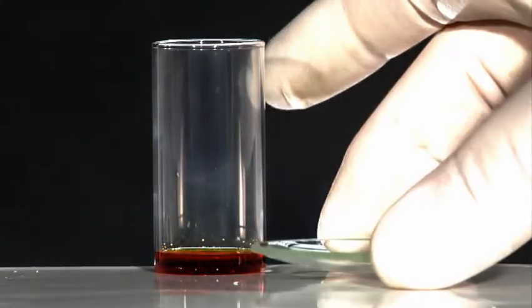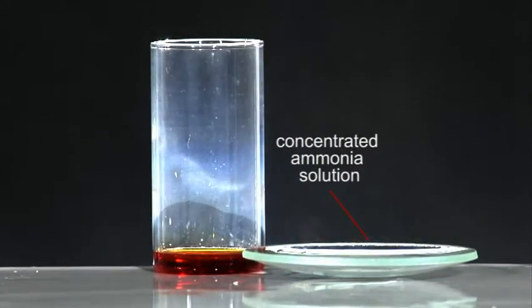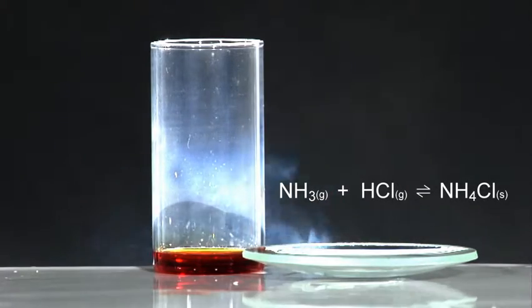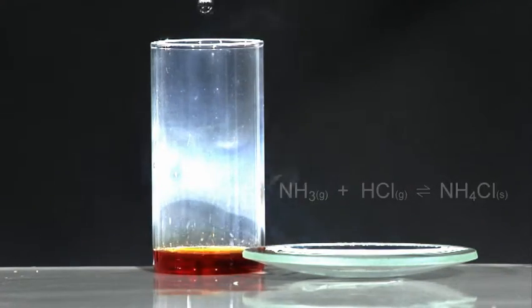Including hydrogen chloride. Here, a concentrated solution of ammonia is used to show the presence of hydrogen chloride gas produced by the hydrolysis reaction.